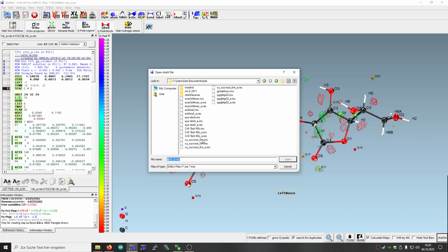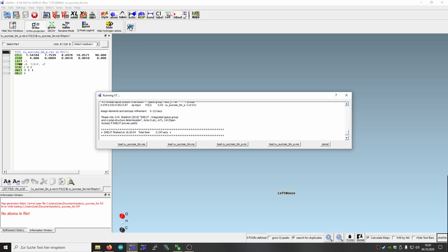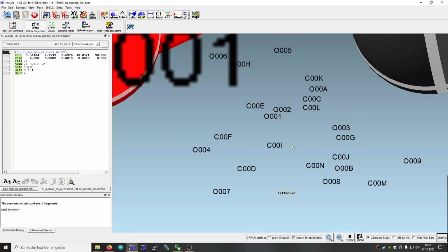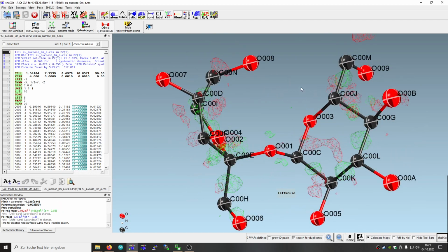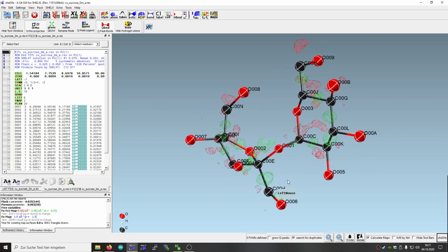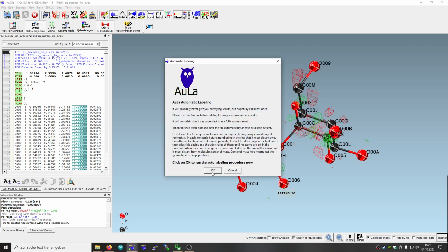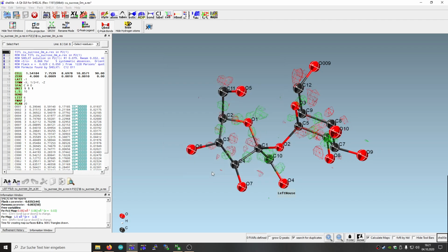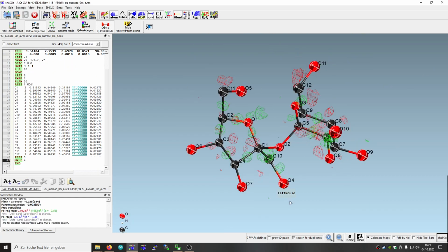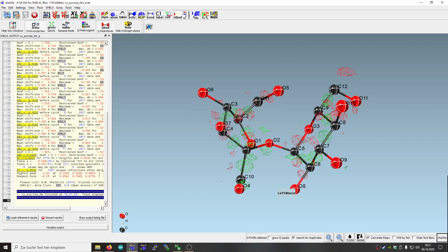So probably it's here. So again we have to use XT, and again there's only one solution, so we choose underscore A. And this is probably also well known, that's the sugar you probably put in your coffee. And again we just hit the auto labeling function because I'm too lazy to rename all of them. So that's 23 atoms, and yeah, we just refine them anisotropically.